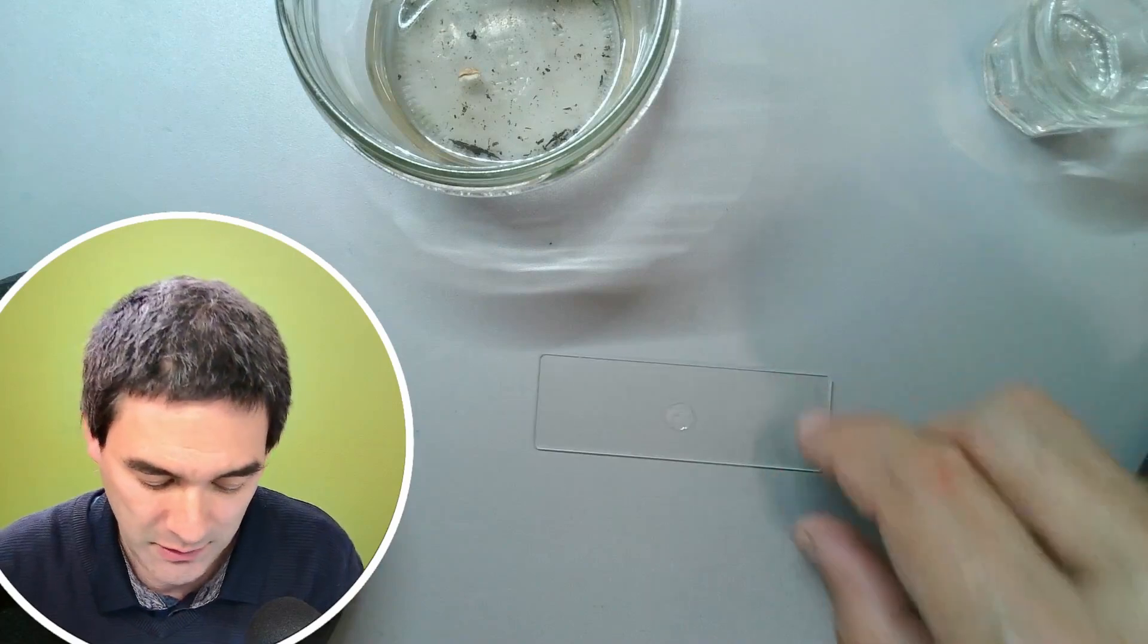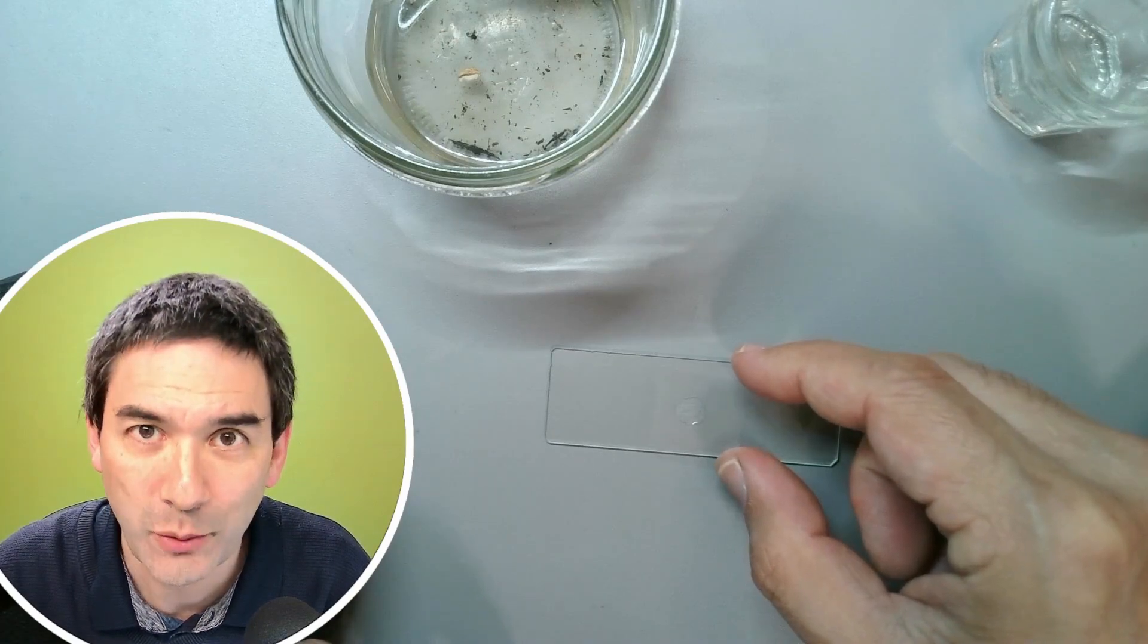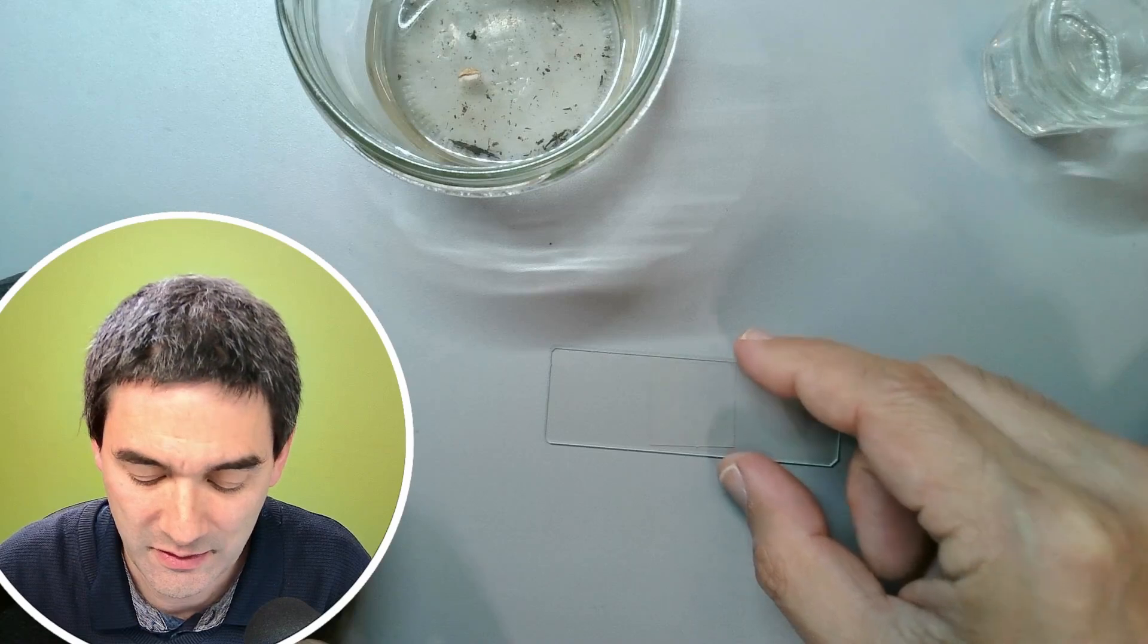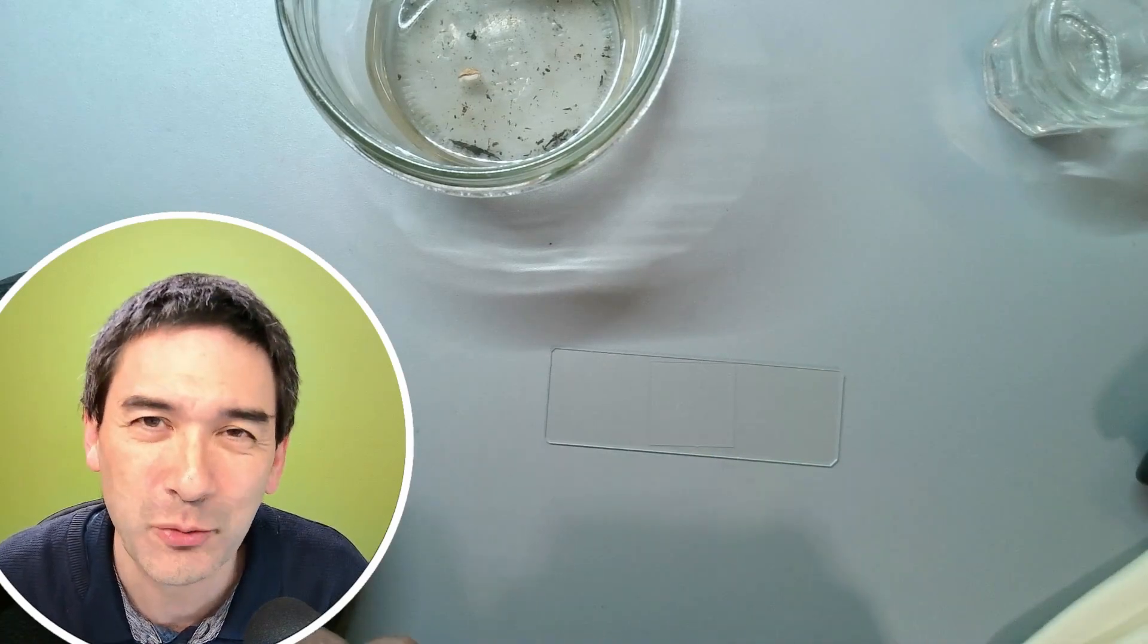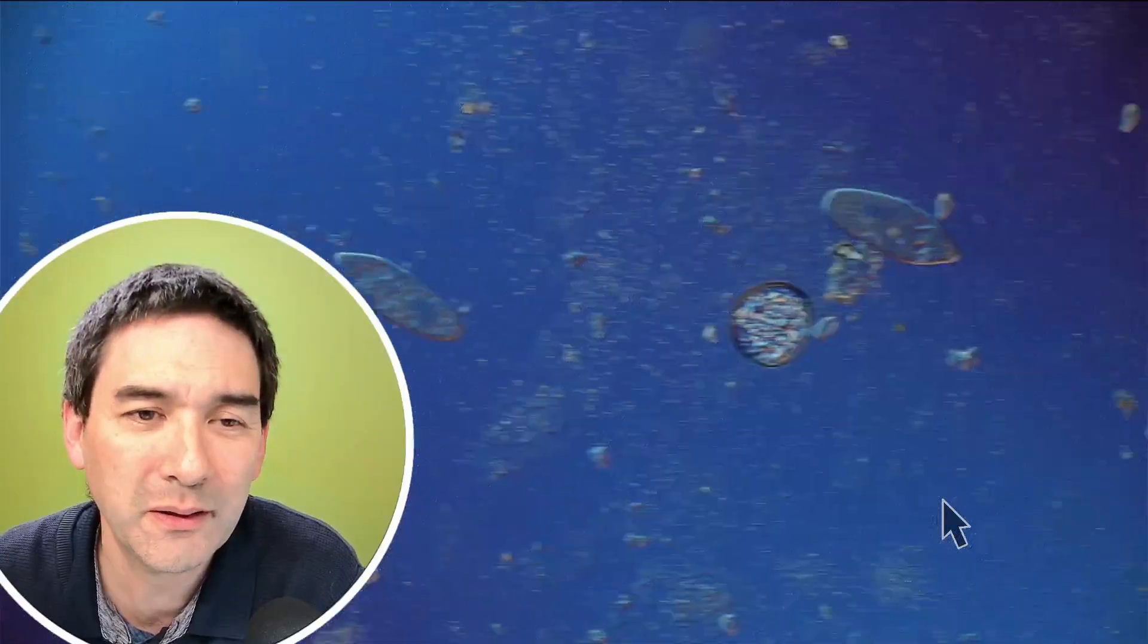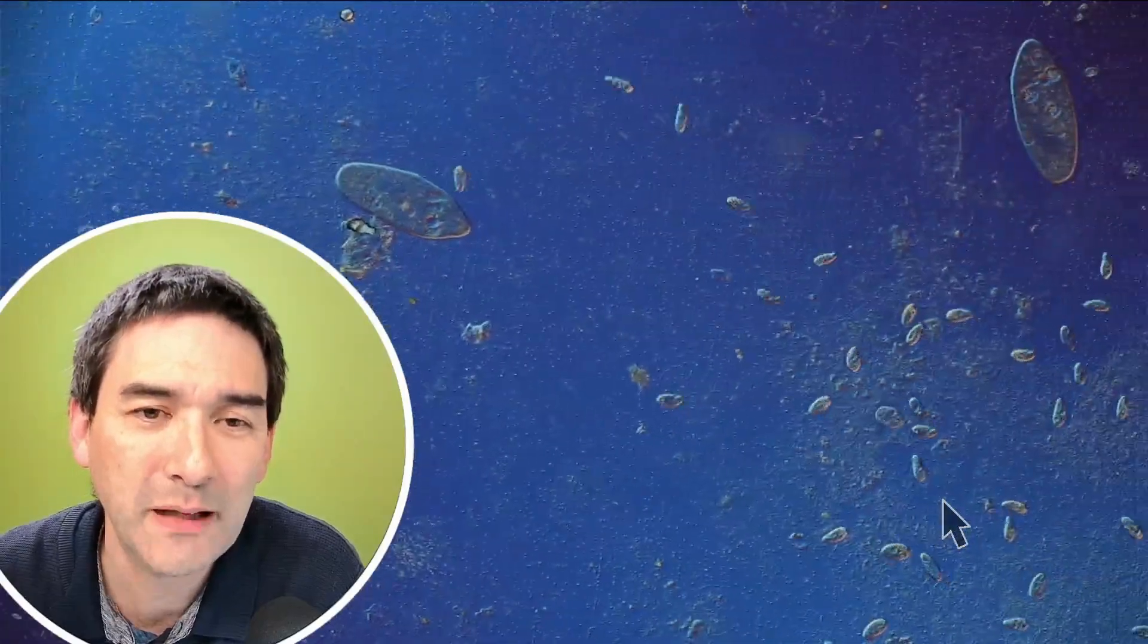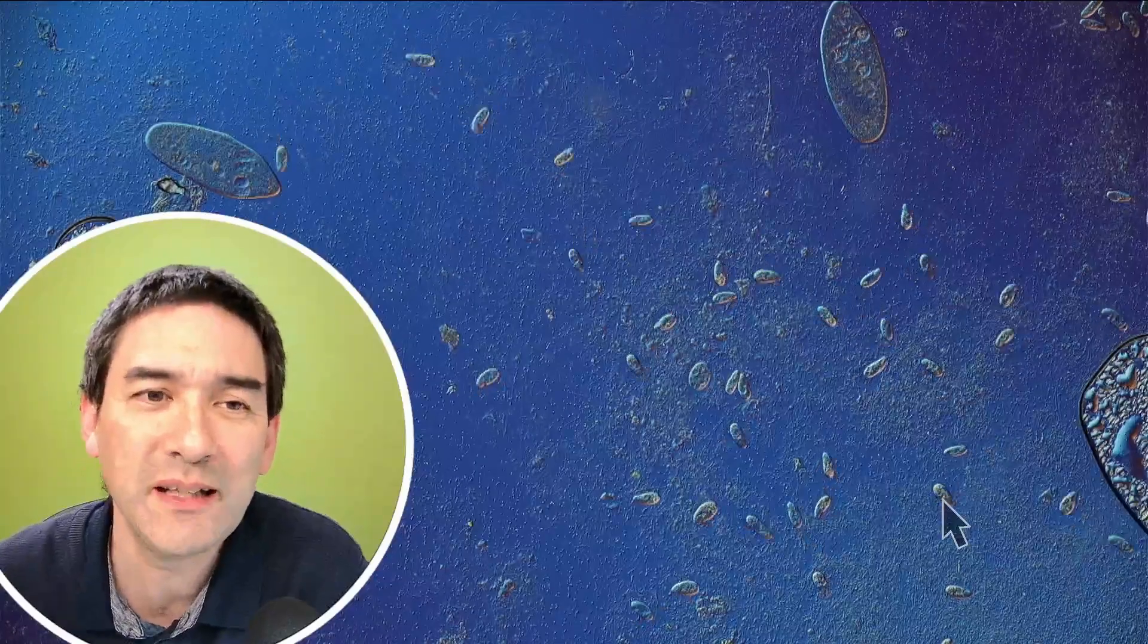So what about the slide over here? All I have to do is drop a cover glass right on top of this specimen. And now everything can go under the microscope. Let's see what we're able to find. Here we go. Look.